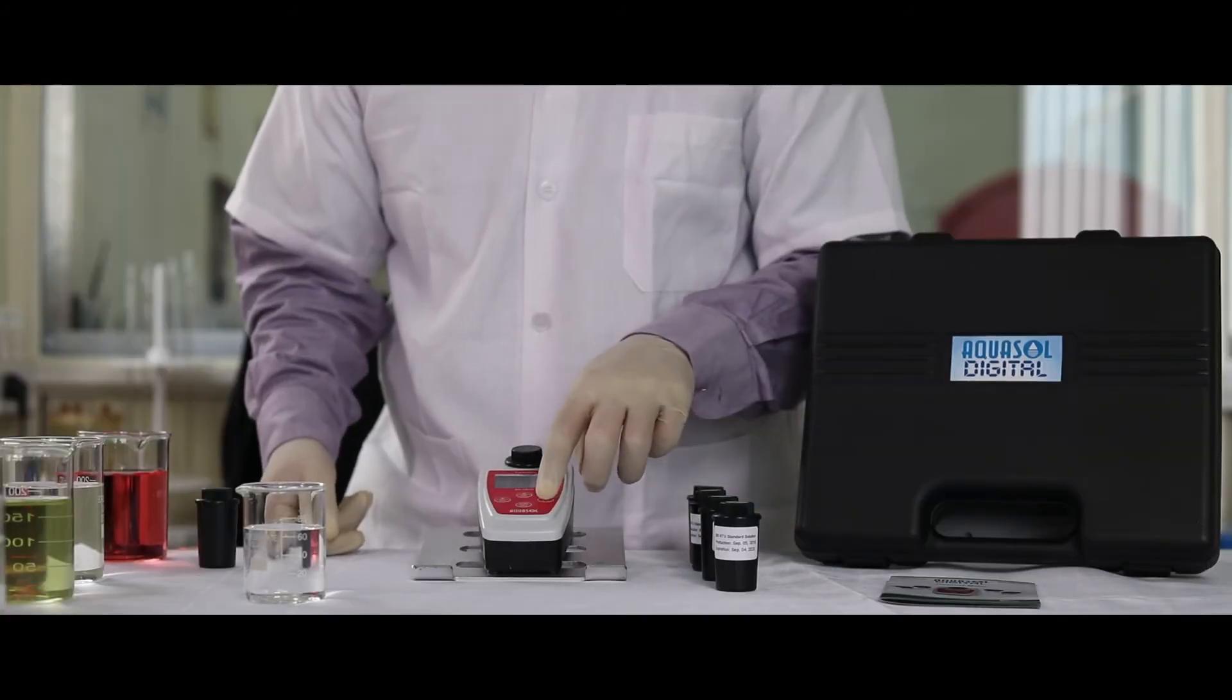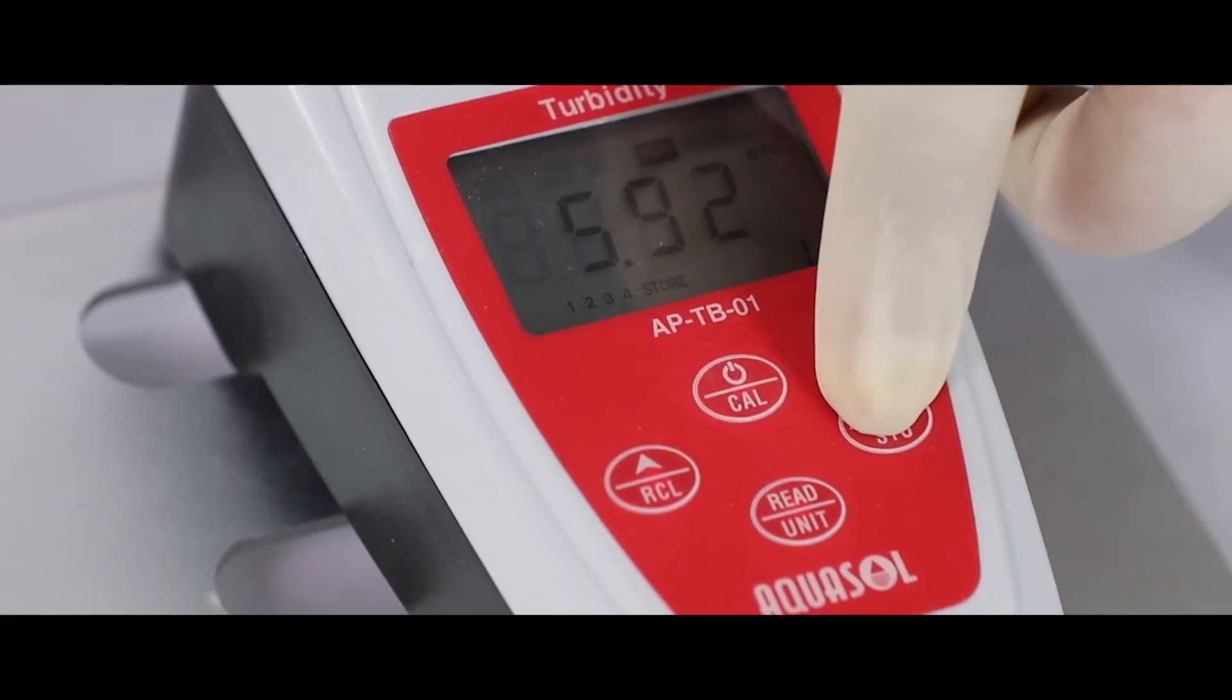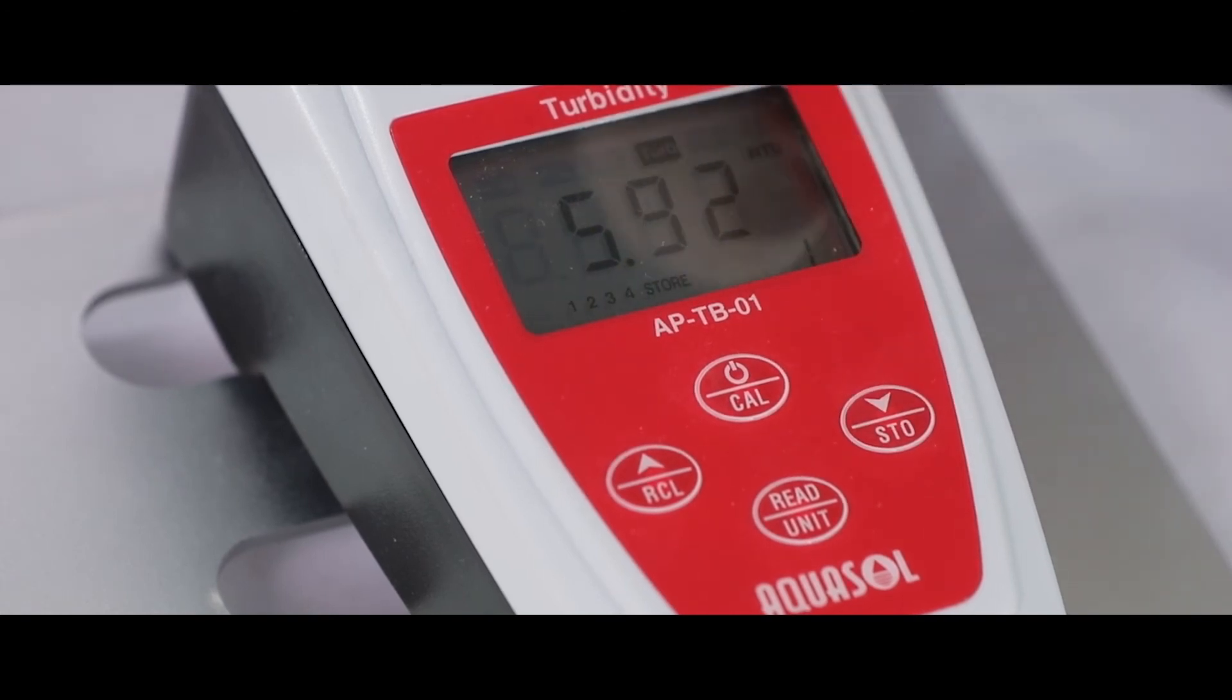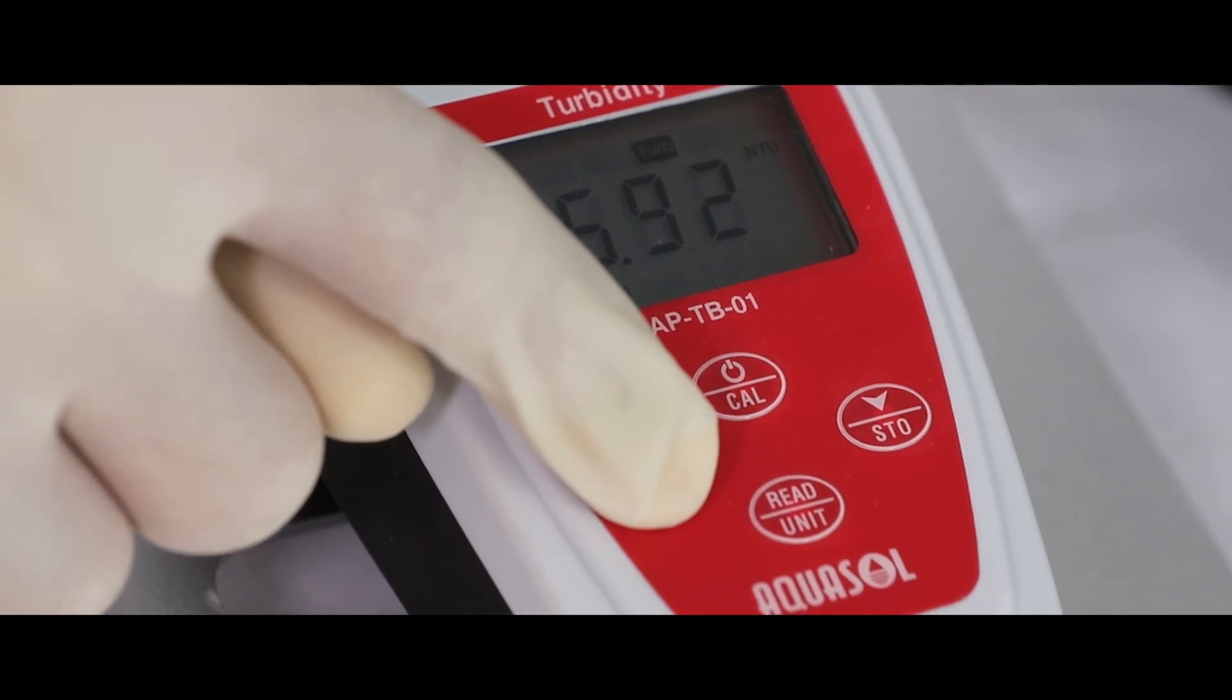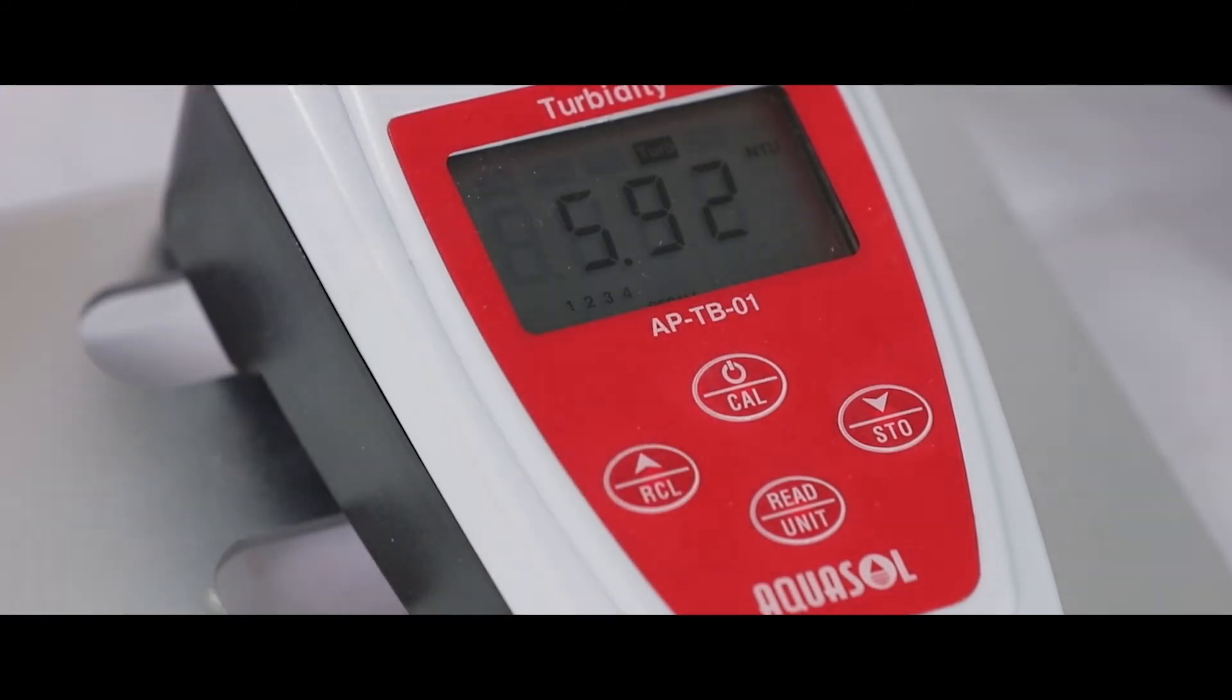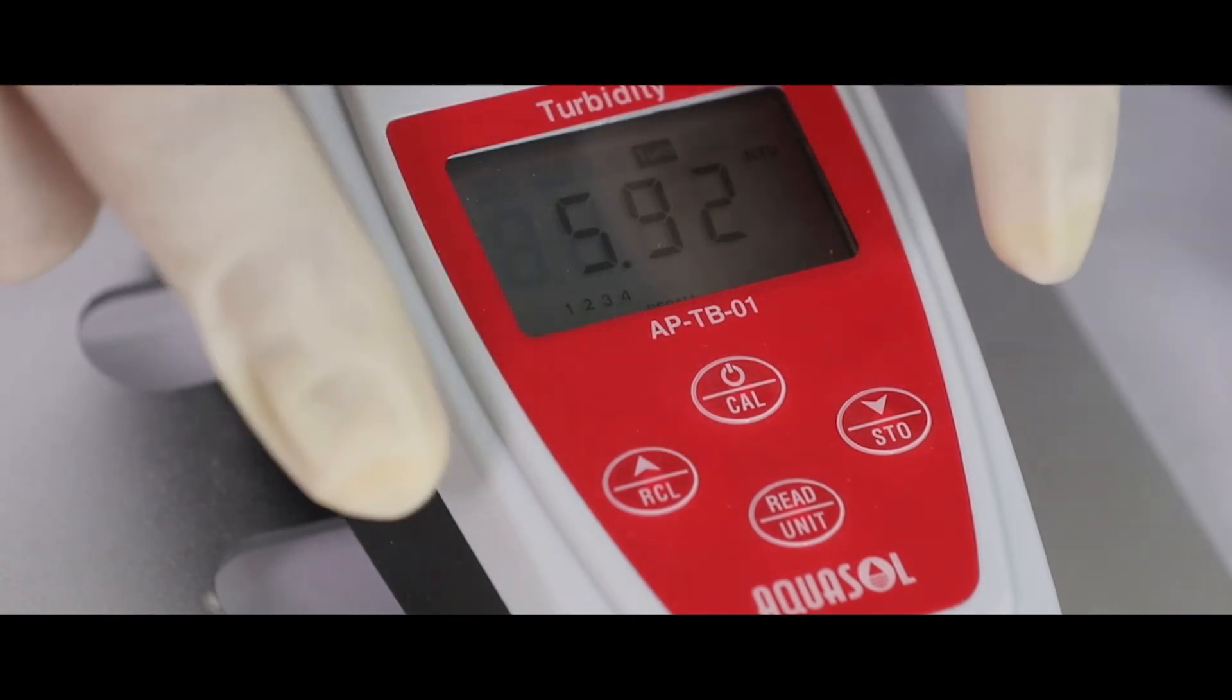To recall the reading, press and hold the RCL key. To clear the stored data, press and hold both arrow keys together until the meter beeps.